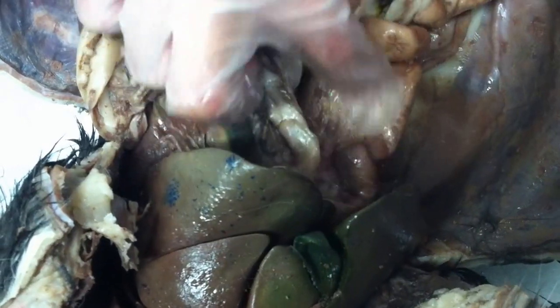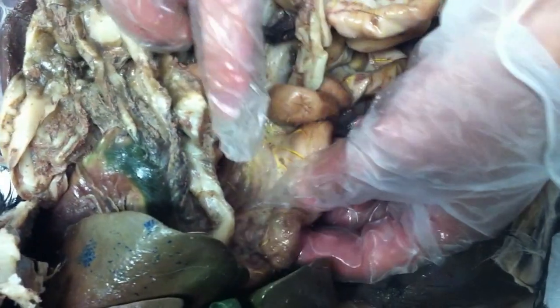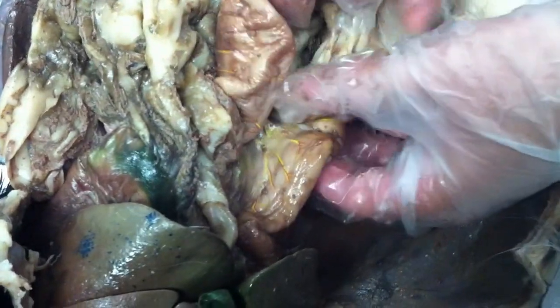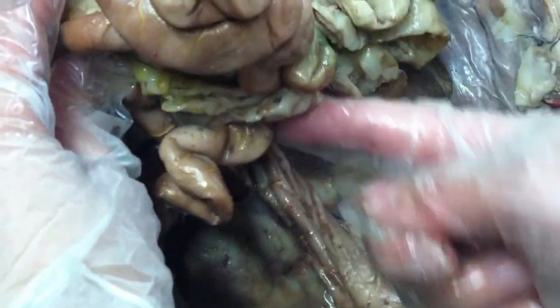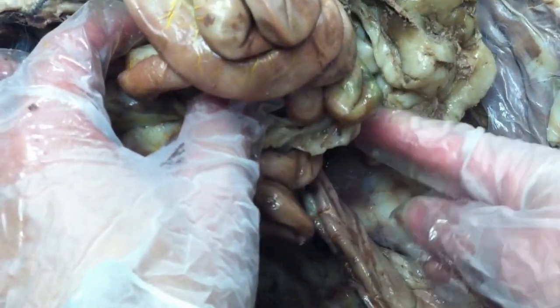You see here, this is the start of the small intestine, and this is called the duodenum. Relatively straight, right? And then it's going to start to fold. That's the jejunum, right? Which one? This part. That's the start of the folding, jejunum, basically. Yeah, all these things.